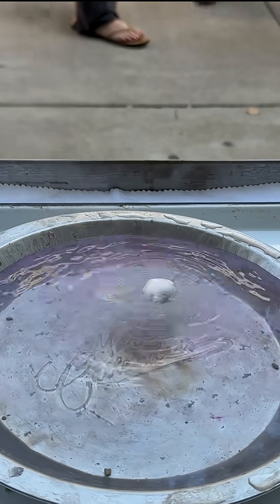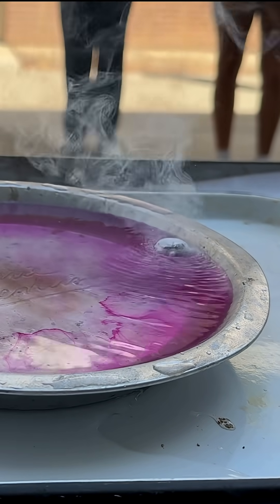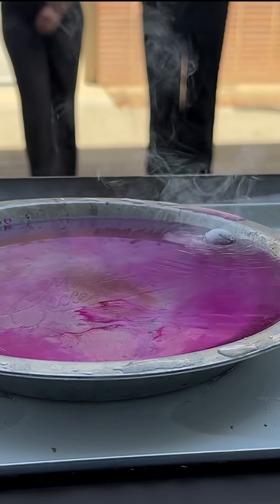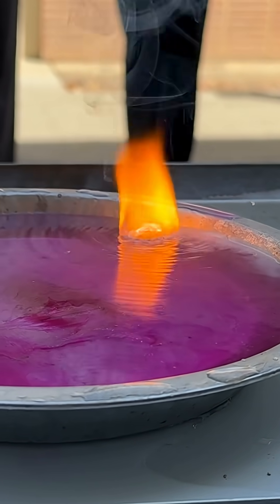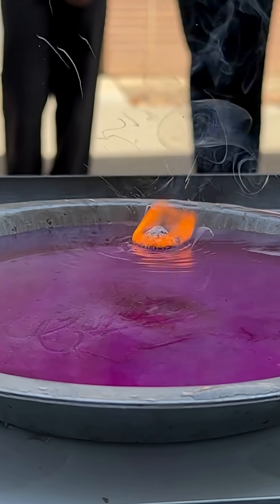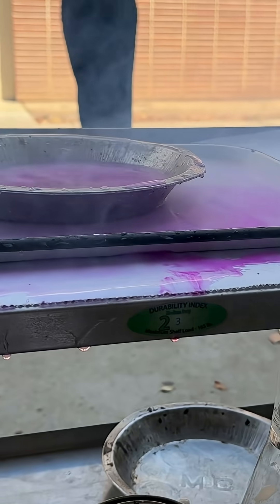Okay, what do we notice about the liquid? Look at that. What's that mean — acid or a base? It's a base. That is science.